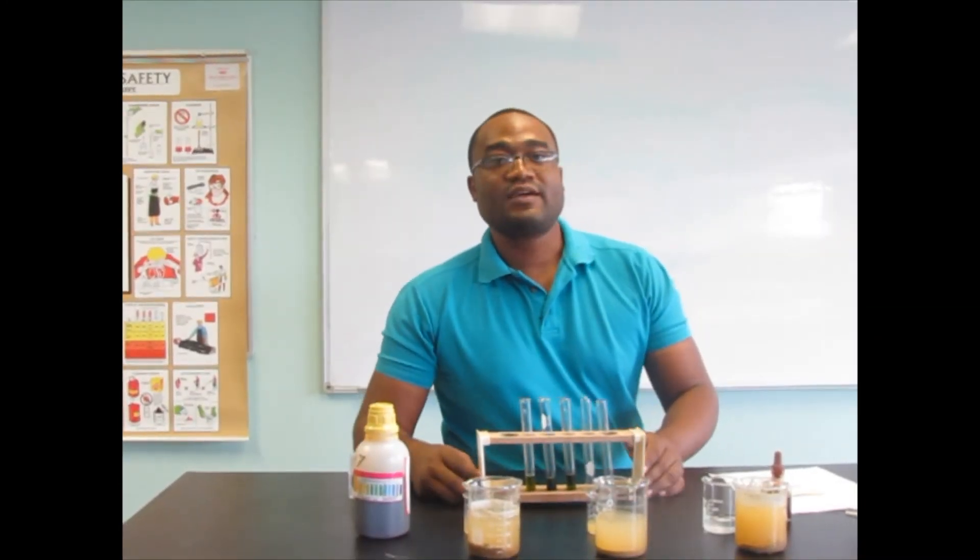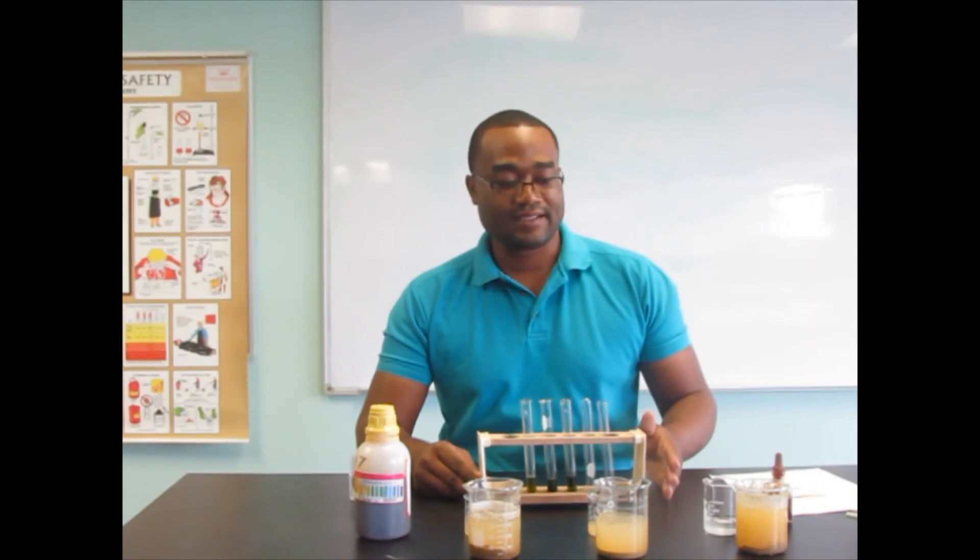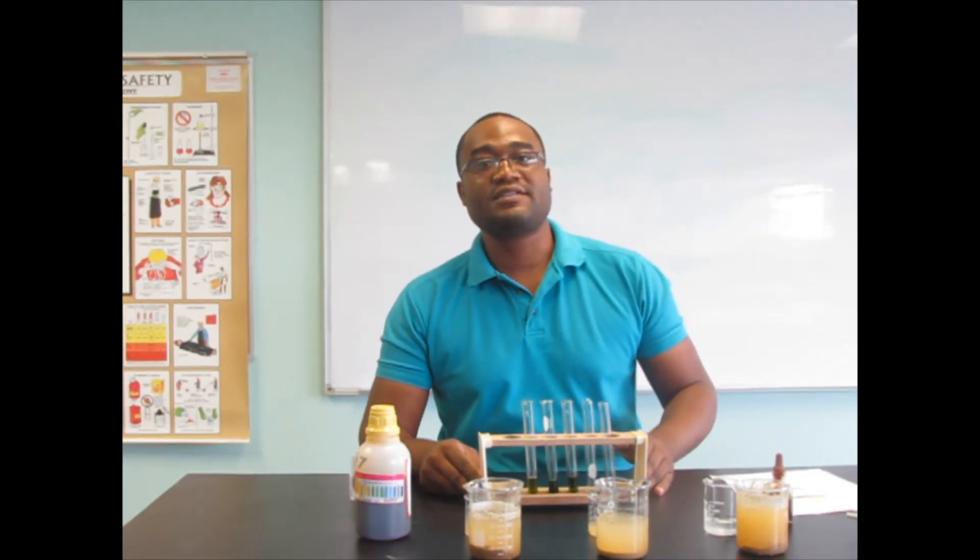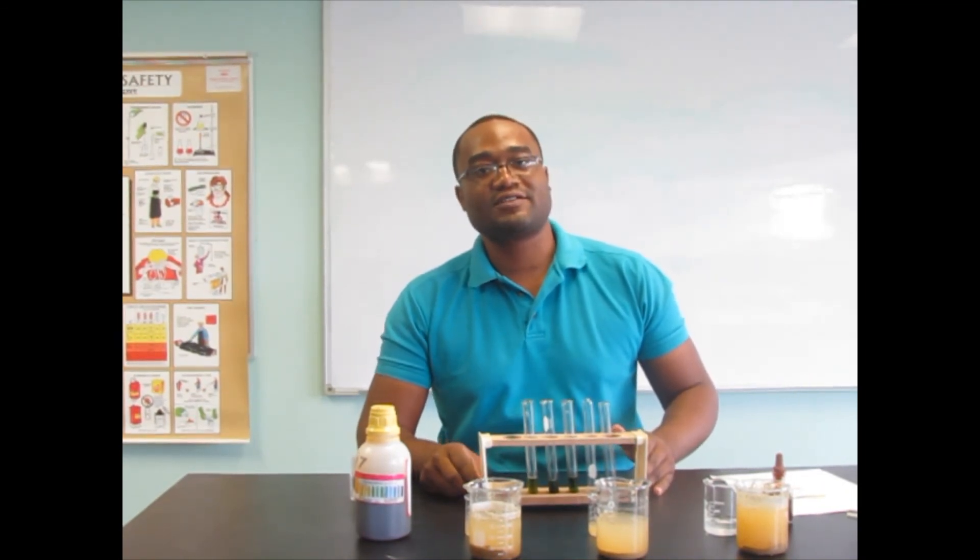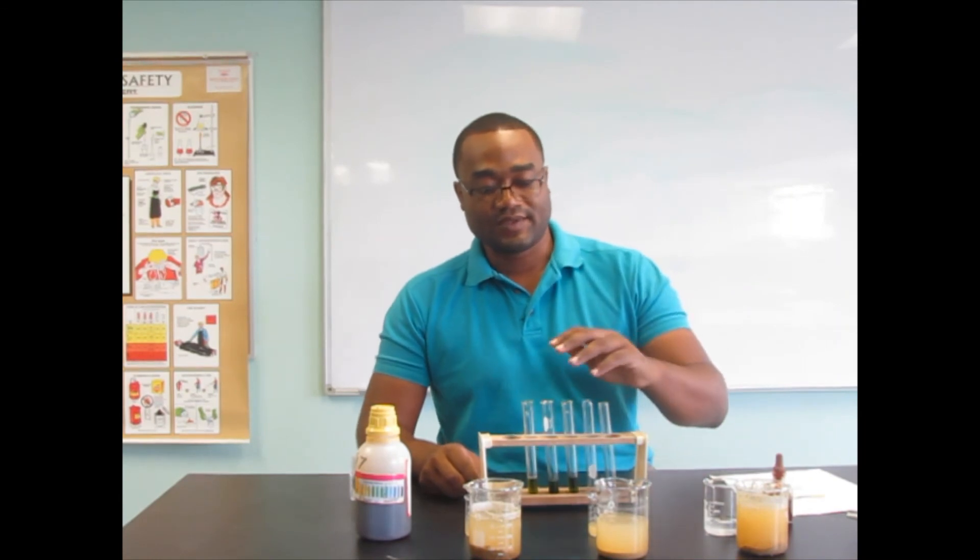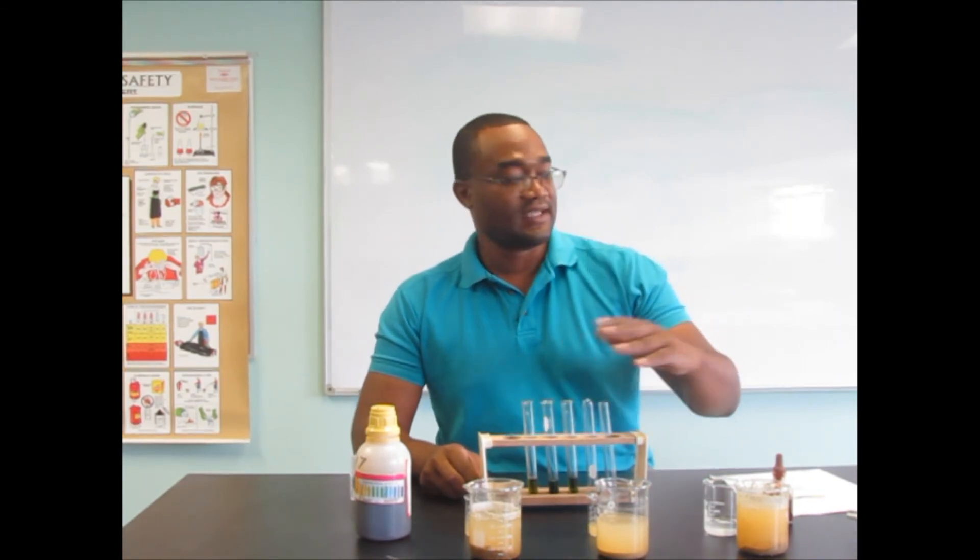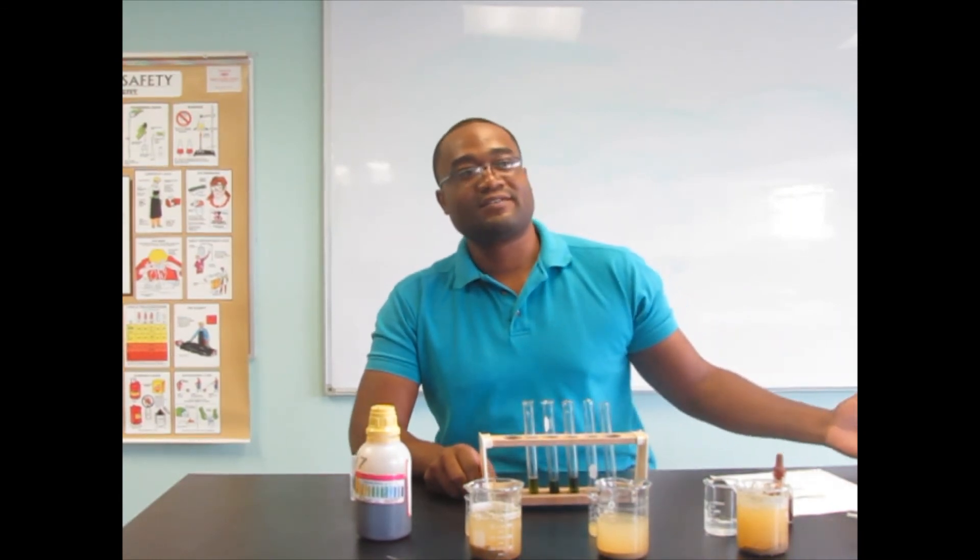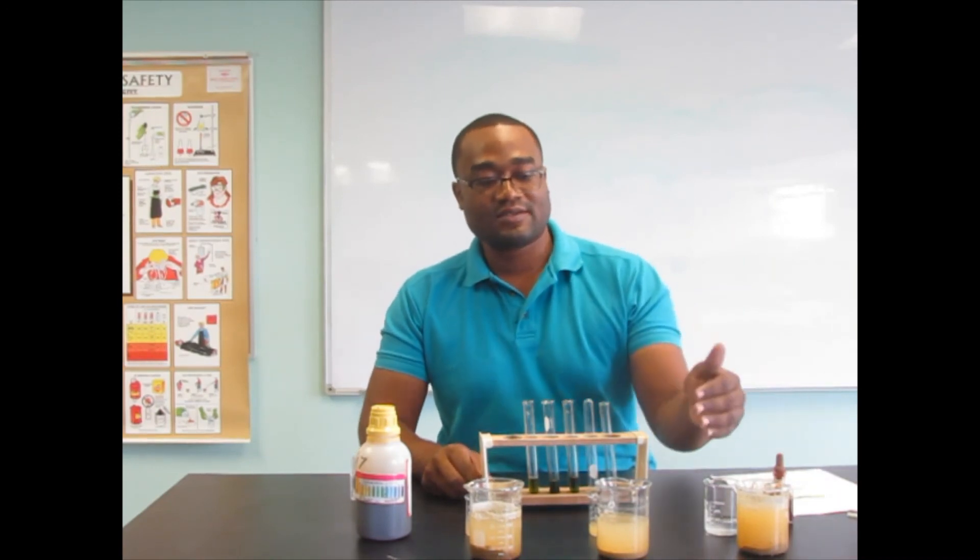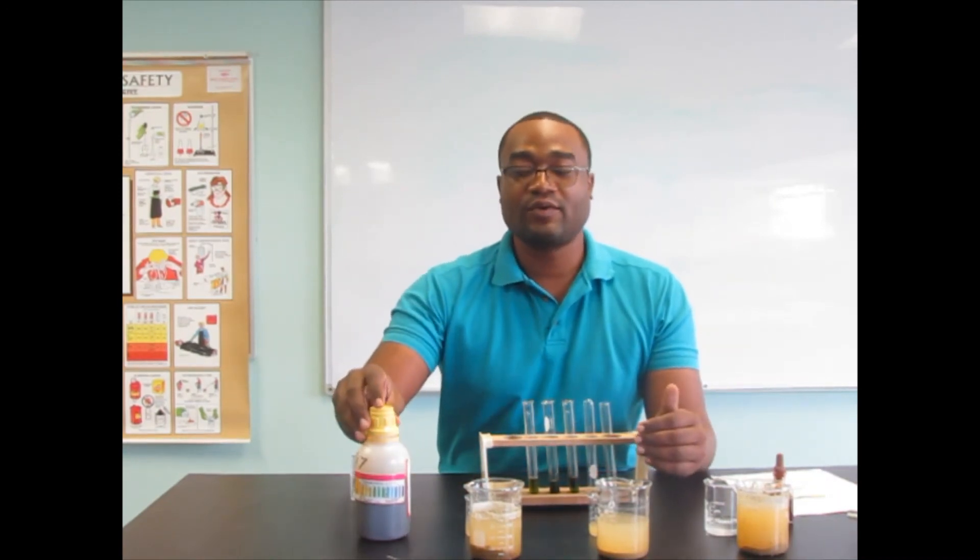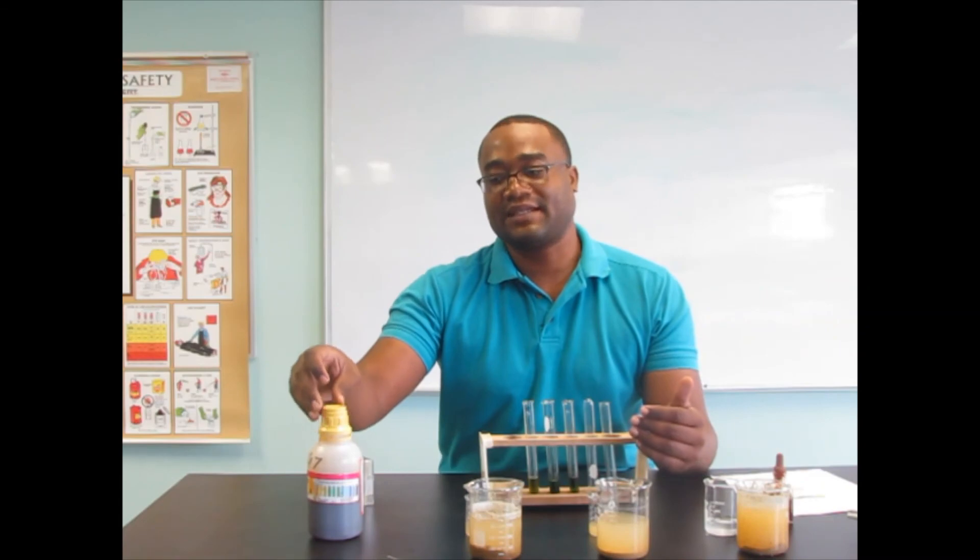So now that we have done our pH test, it's important that we clean and return all our instruments in the lab. We're going to dispose of our samples in the approved receptacle and return our equipment cleaned to the lab technician.